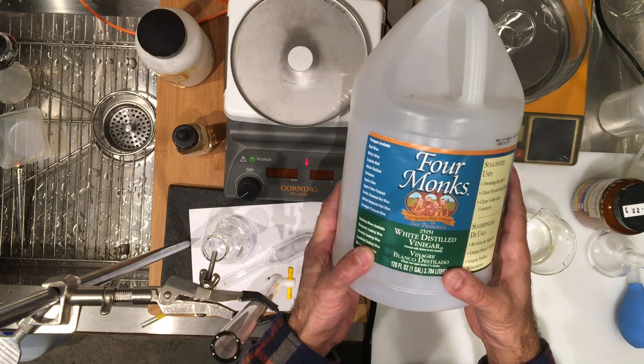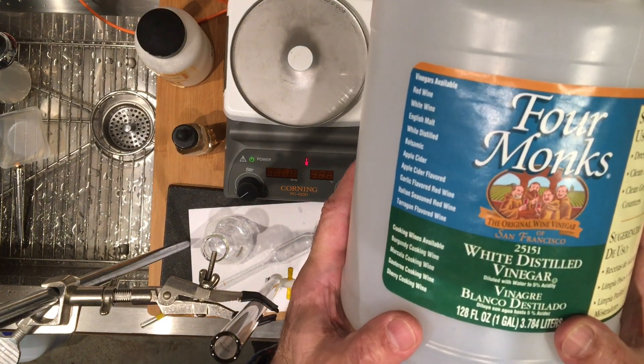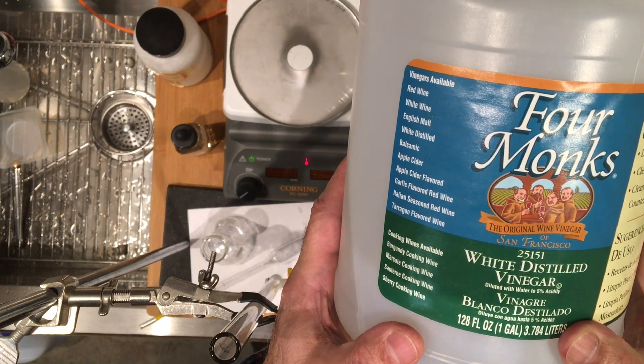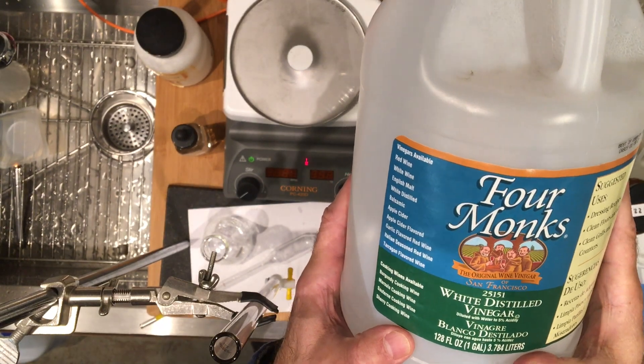And the container indicates that, get it closer, you can see that they have listed the acidity to 5%, so the concentration is roughly 5%.